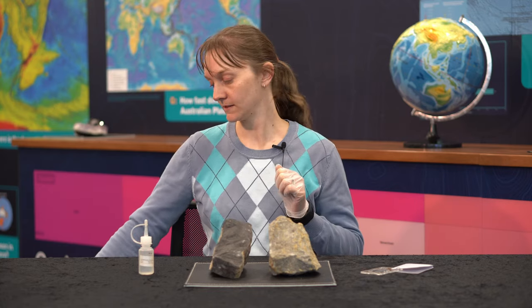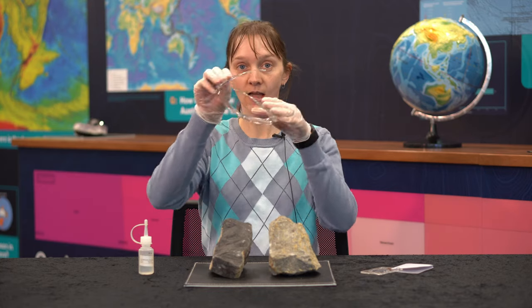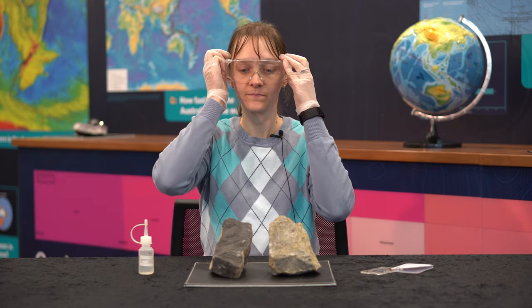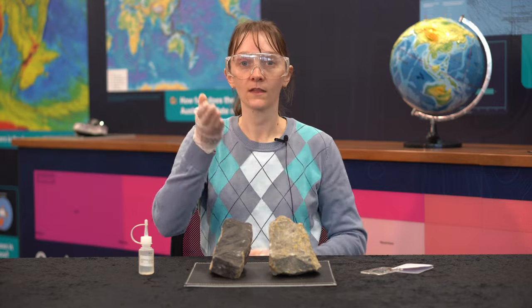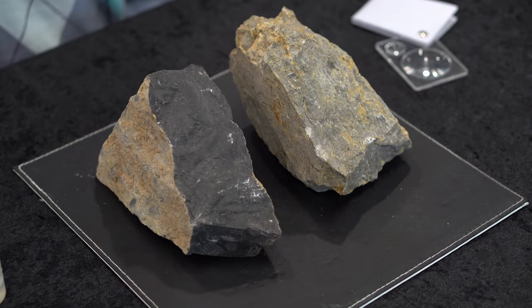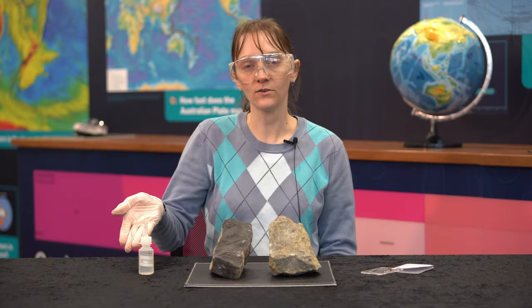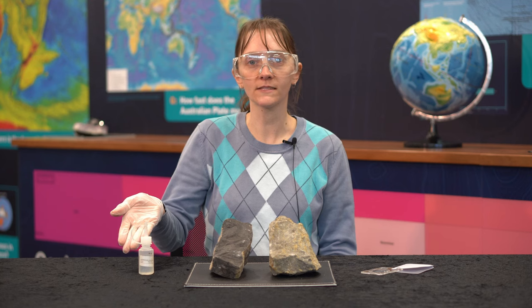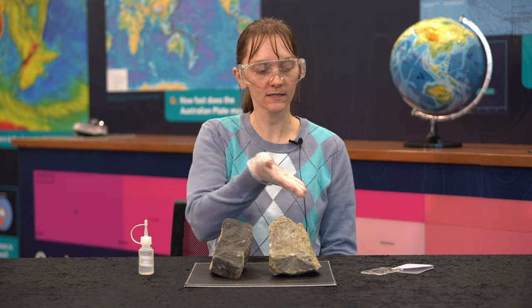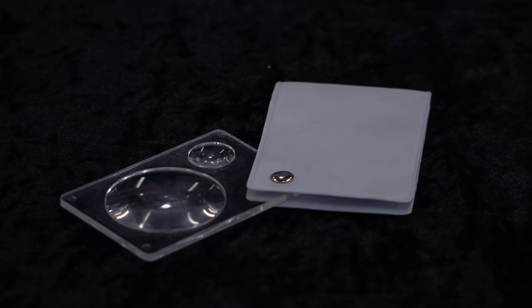For this experiment you will need safety equipment — gloves and safety goggles — unknown specimens, dilute hydrochloric acid at 5 or 10%, and a hand lens.